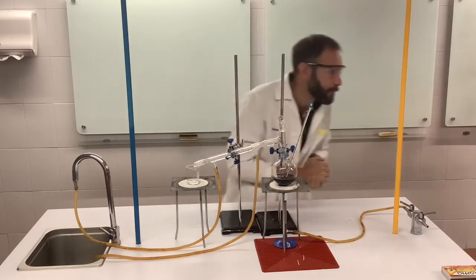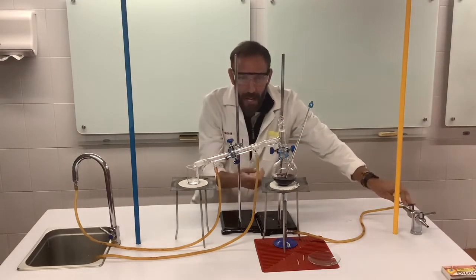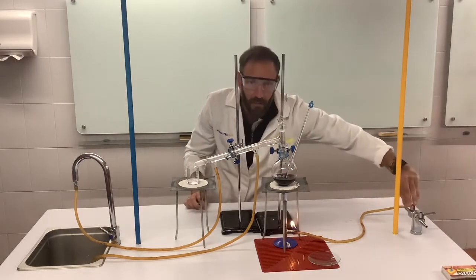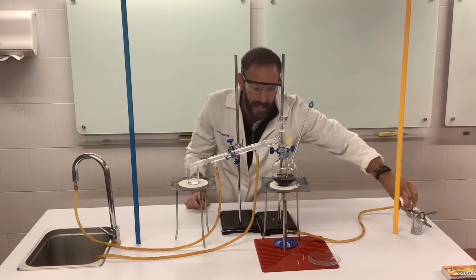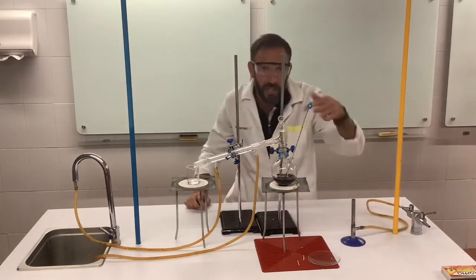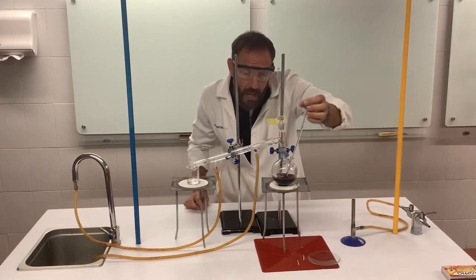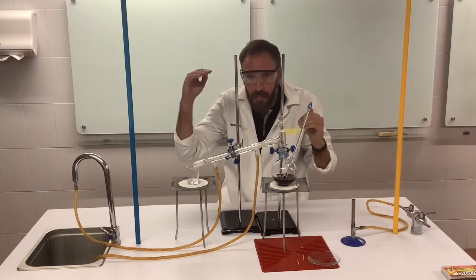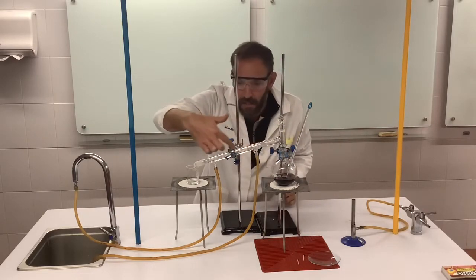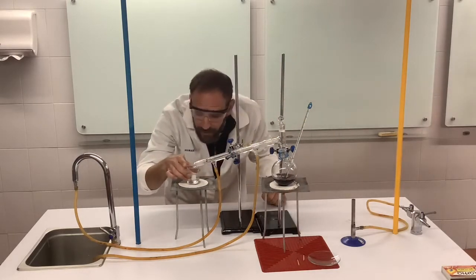Okay guys, so we've collected enough in there. So I'm now going to turn my Bunsen burner off, like so. Whoops, that's the wrong way around. Oh, and I set fire there. So that's off. Just going to double check the temperature here for you. It's gone up to 82 degrees. So the water wouldn't have evaporated, but the ethanol would have. It's evaporated and it's condensed down there. You see? Oh, we've got a lot of ethanol there.